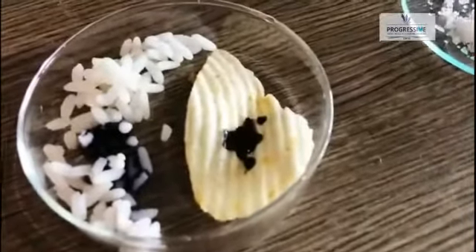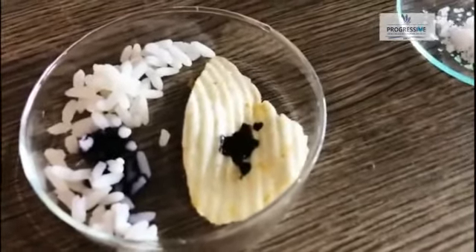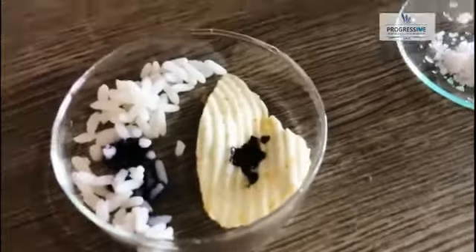Here also we can see the blue-black color. So we can confirm that the potato chips contain starch. If starch is present in the food, the blue-black color we can see.